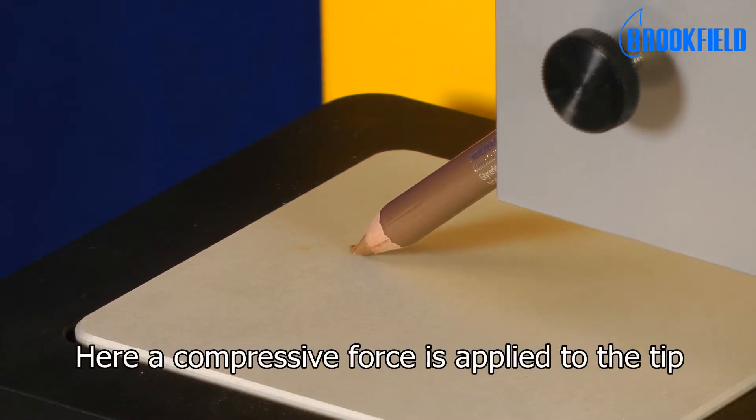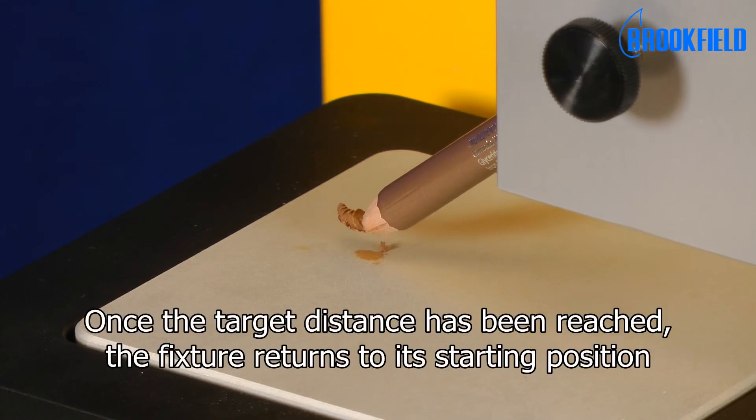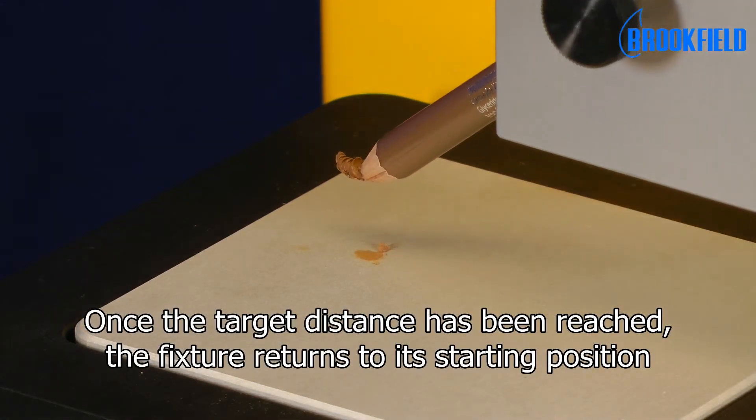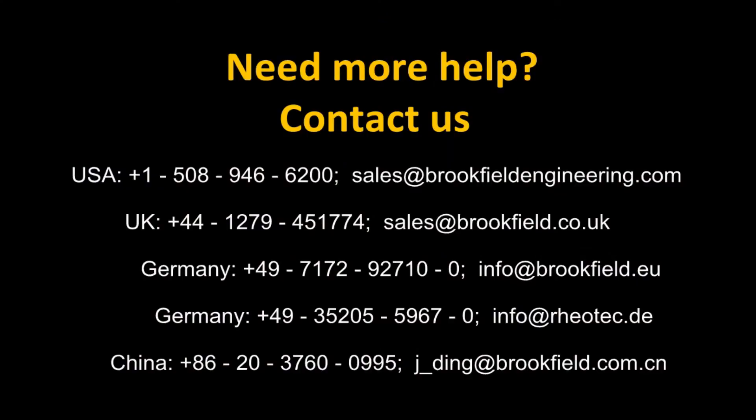Here a compressive force is applied to the tip. Once the target distance has been reached, the fixture returns to its starting position.